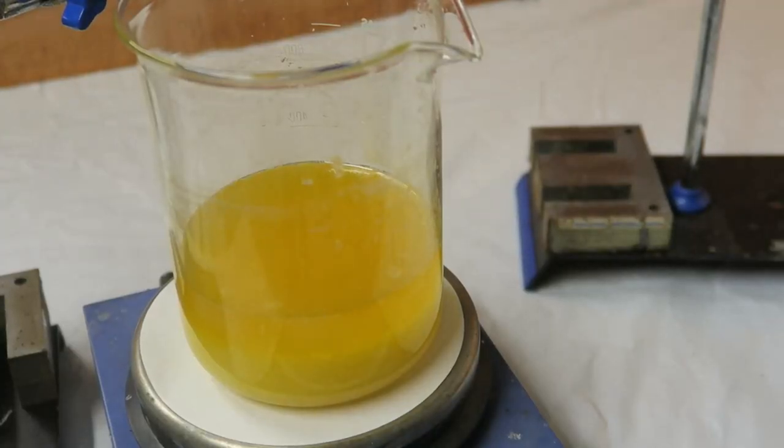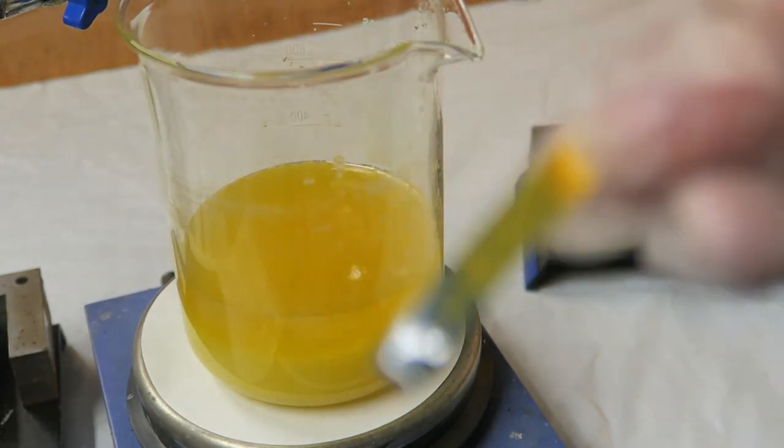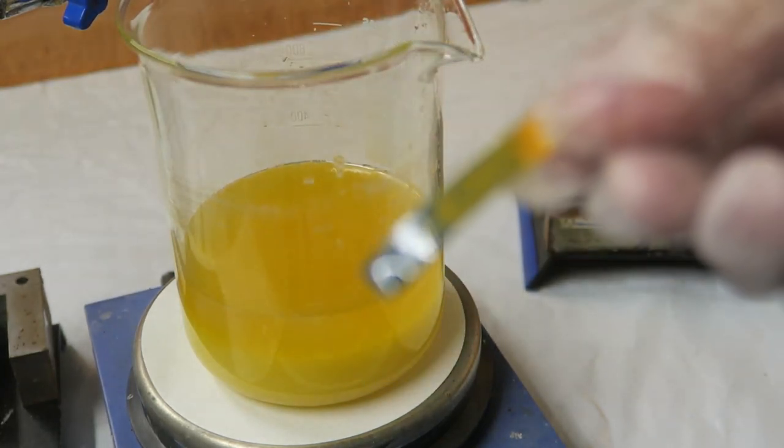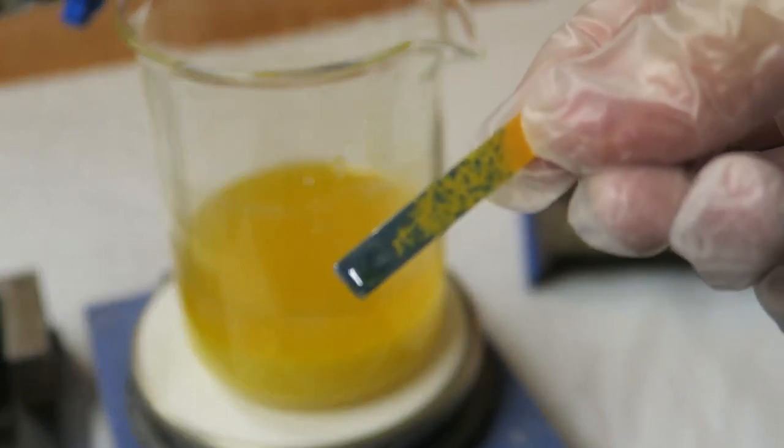After finishing the reaction, the whole content is then transferred to a beaker. I've quickly checked the pH and added an appropriate amount of acetic acid. After the layers have separated, the aqueous layer was discarded.